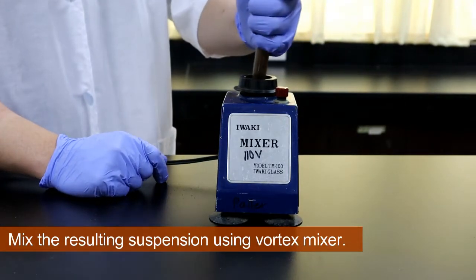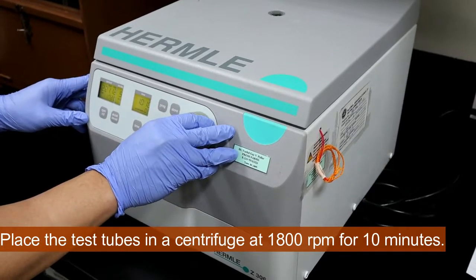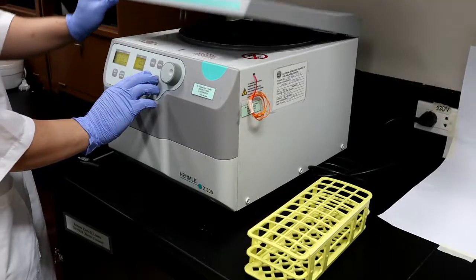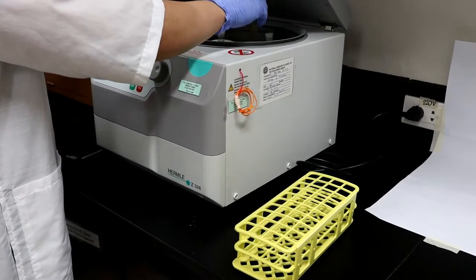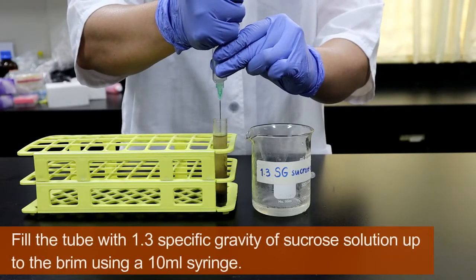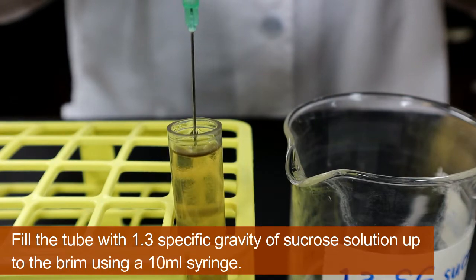Mix the resulting suspension using a vortex mixer. After mixing, place the test tubes in a centrifuge at 1,800 rpm for 10 minutes. After centrifugation, fill the tube with 1.3 specific gravity Sucrose solution up to the brim using a 10 ml syringe.